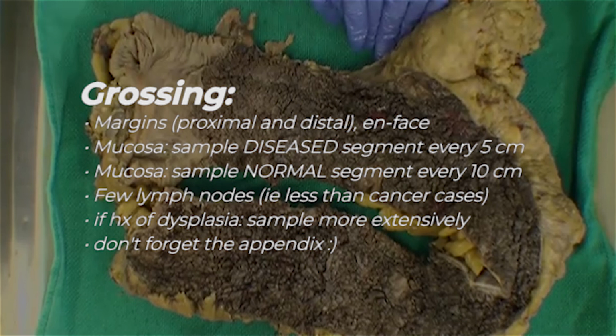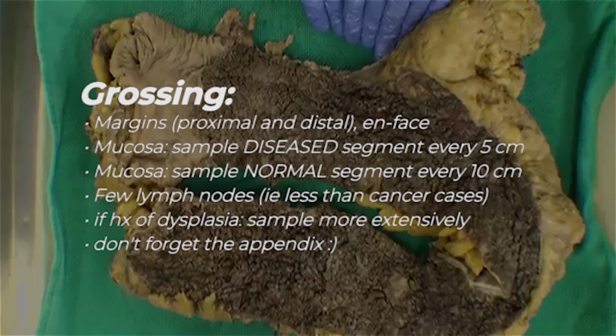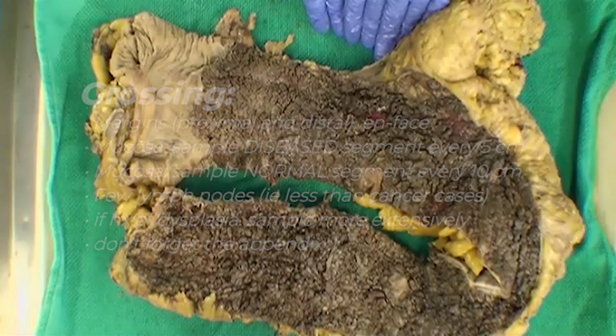And of course, we're going to look carefully at our fat as well to make sure there's no nodular areas or suspicious lymph nodes, and we'll submit 1 or 2 blocks of representative lymph nodes, assuming there's nothing abnormal, just to document that. And of course, before we gross any specimen, we want to go back to the history and any previous biopsies to make sure there's no previous history of dysplasia. And if there is, we're going to sample more thoroughly in that particular area.